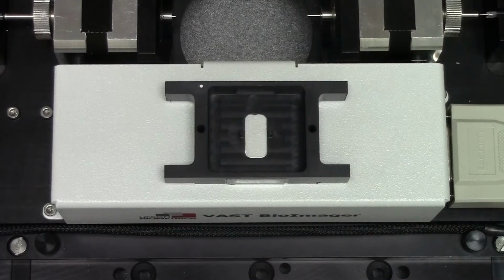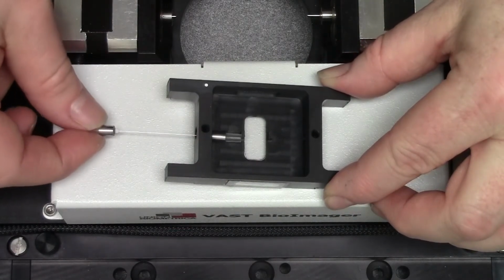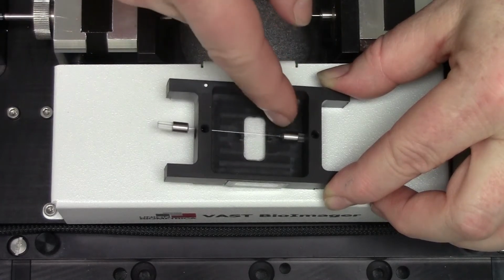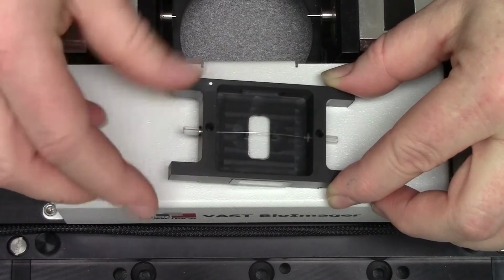Holding the capillary by one of the silicon ends, carefully thread the capillary's other end through the channel. Angle the capillary upwards to clear the two positioners in the center of the tray before allowing it to rest against them. Carefully align the far silicon end with the channel and put pressure on the end of the metal collar to push the capillary into its final position.